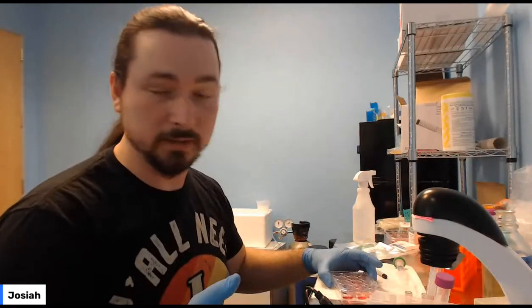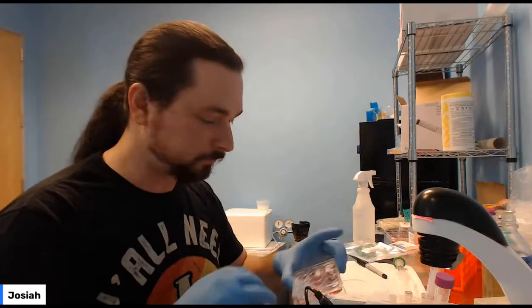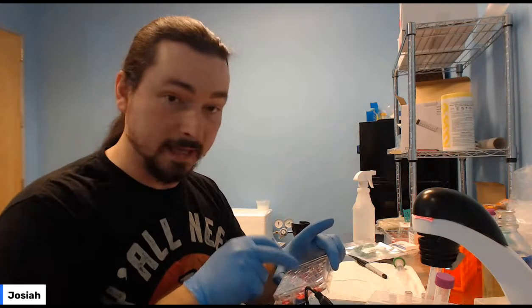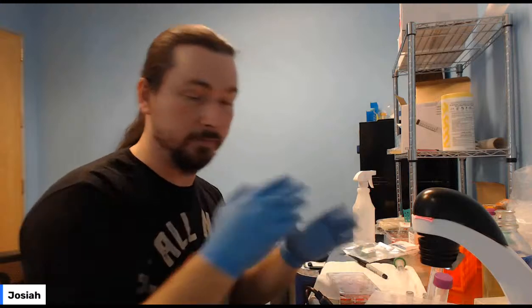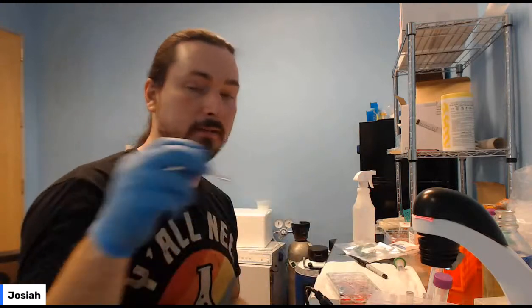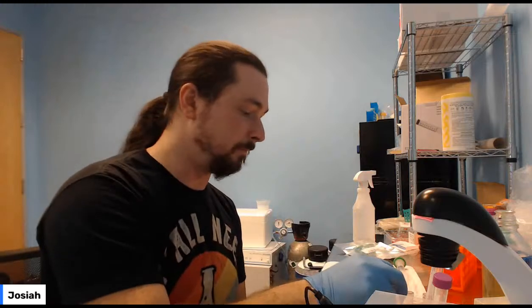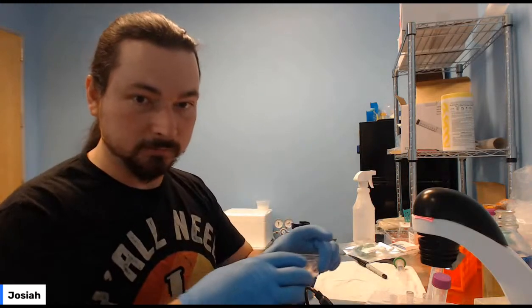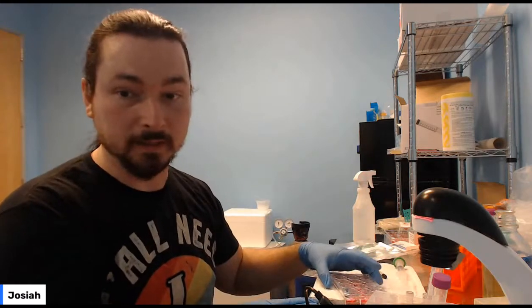The more you use, the darker it is, but you don't have a whole lot to start with. So what you can do is add both G418 in whatever concentration you discovered, and about 15 microliters of the X-Gal solution. Just after you add them, give them a little stir, and then pop it back in the incubator.